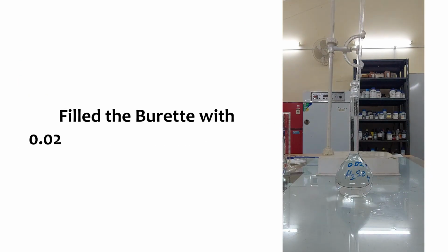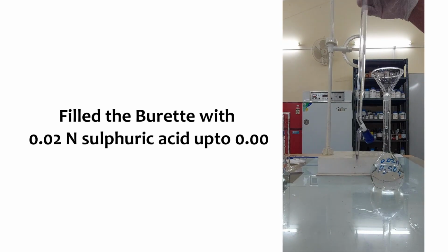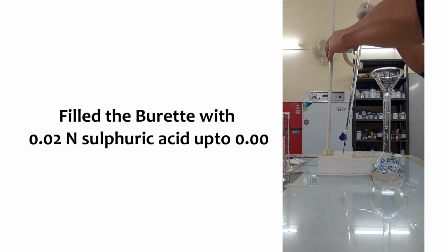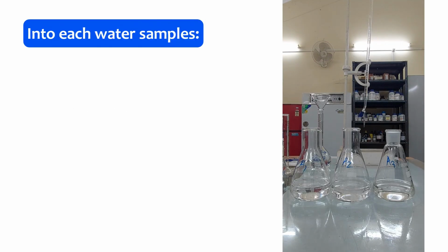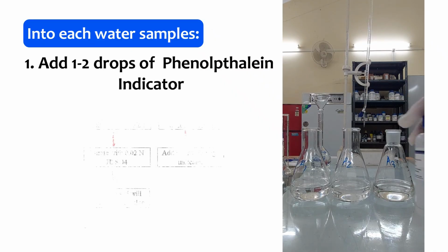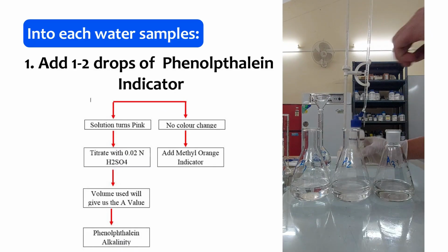Next, fill the burette with 0.02 normality sulfuric acid up to the 0 mark.